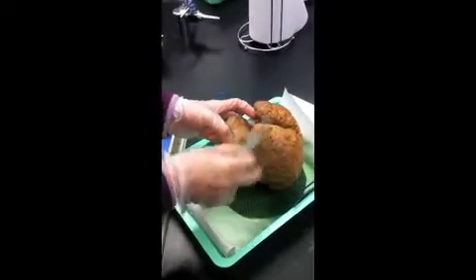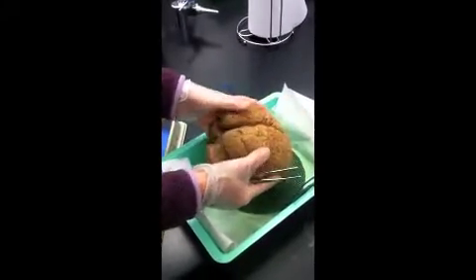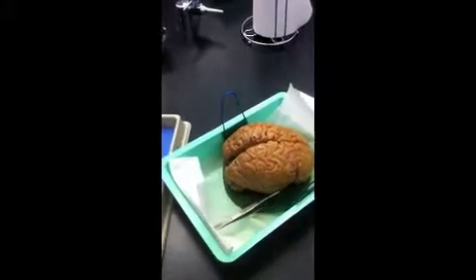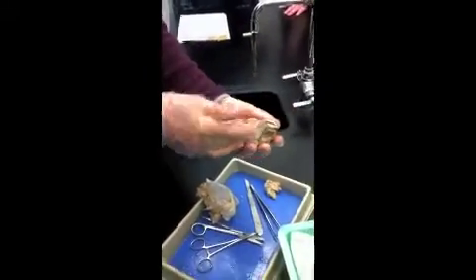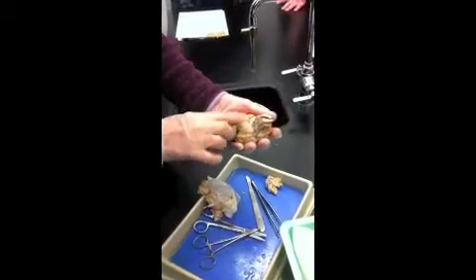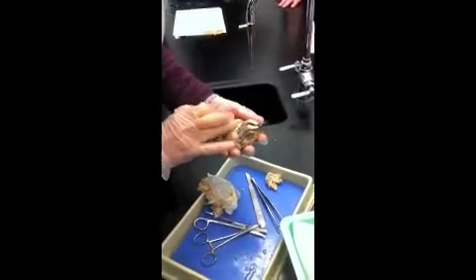All right, so you can look at this on your own. I don't want to tear him. Let's go to the ventral surface. What can we see here?